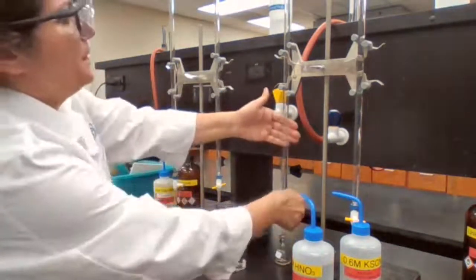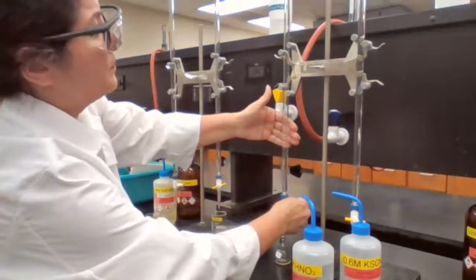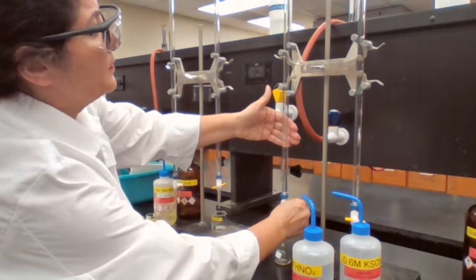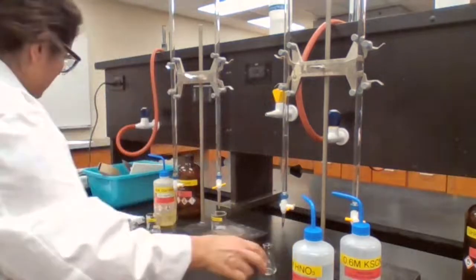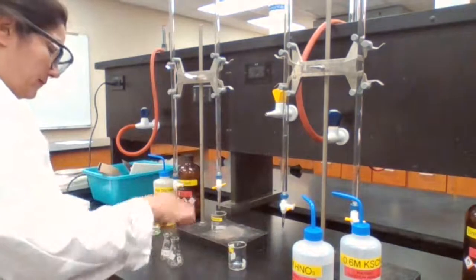Go from 38 to 41. Okay. Then C is ready.